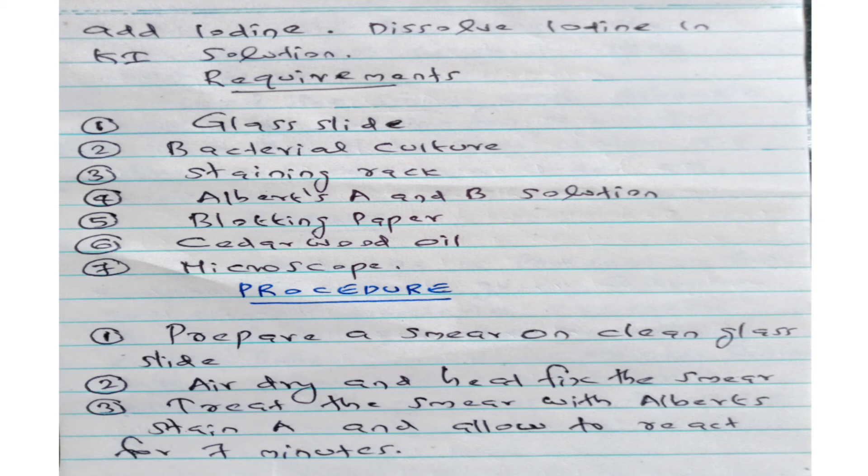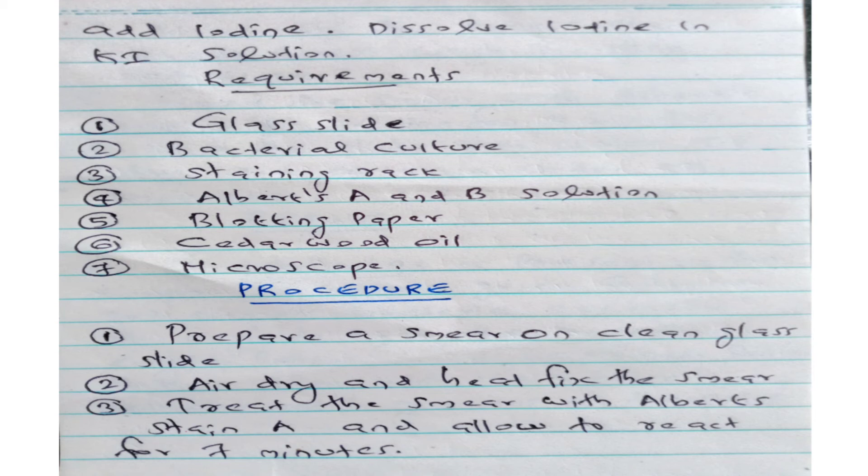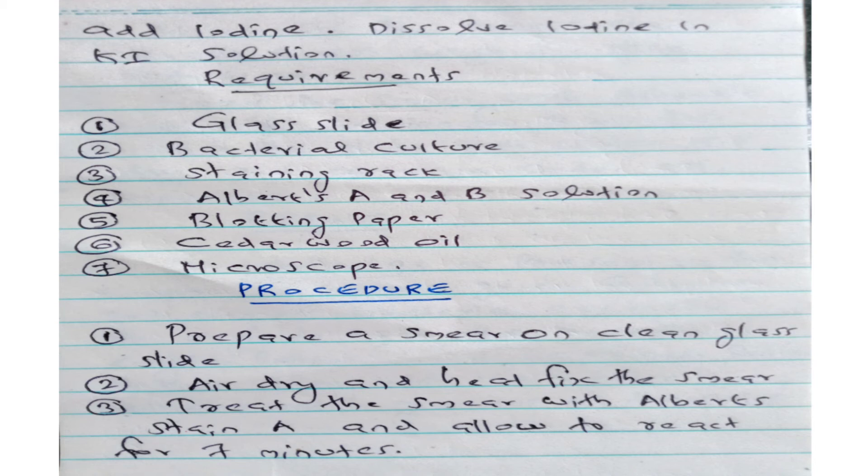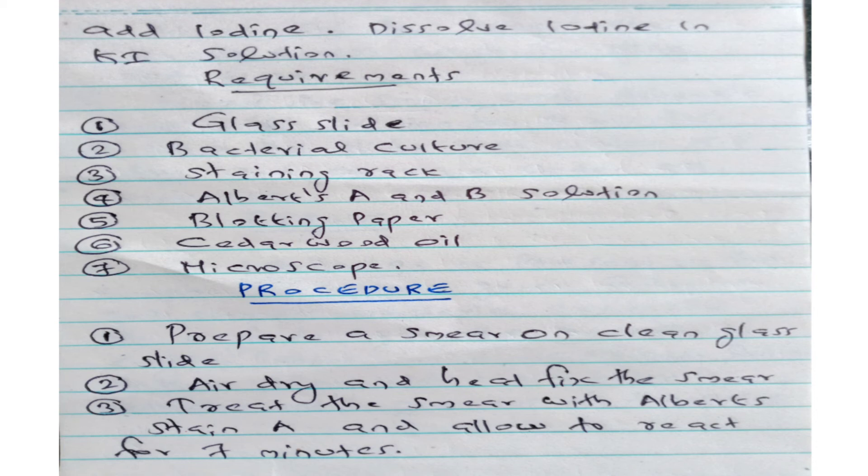What are the requirements of granule staining? Glass slide, bacterial culture, staining rack, Albert's A and Albert's B solution, blotting paper, cedar wood oil, and microscope.